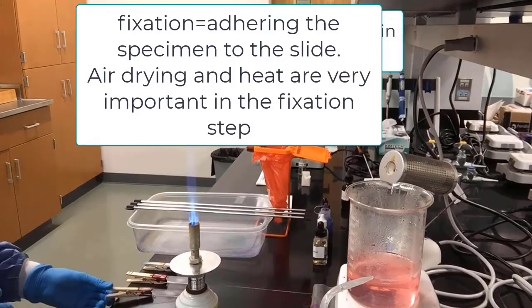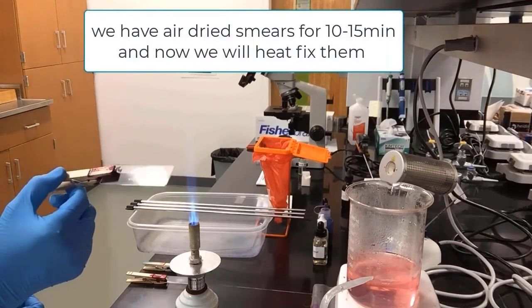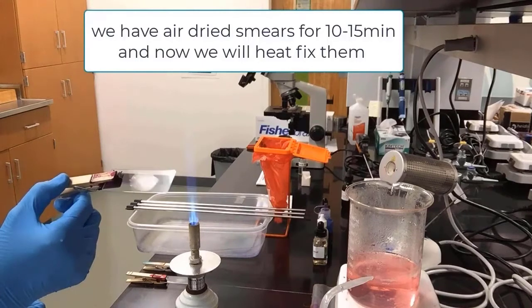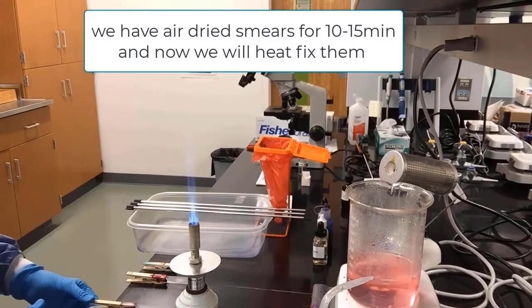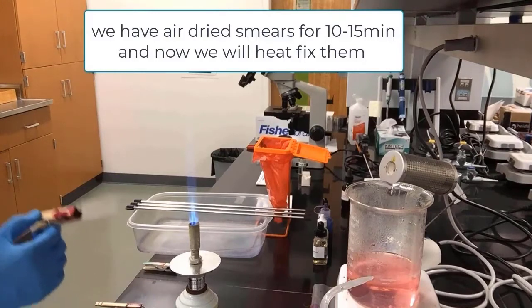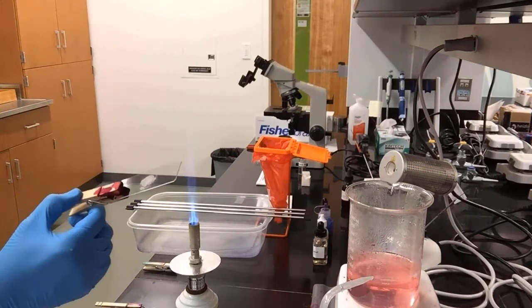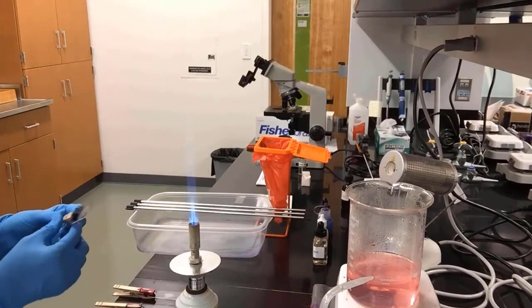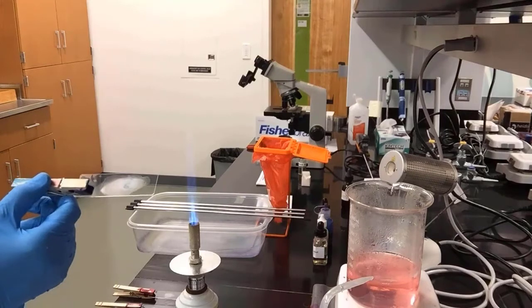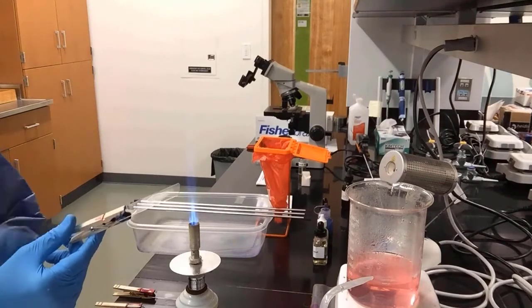10-15 minutes are over. We have clipped our slides. You can see the smears here have air dried. And remember, we have to fix them, glue them to the slide. So we have air dried them for about 10-15 minutes. They are very nice smears, ready to heat fix. And here's our 3rd smear. You can see they're nice dry smears. And now we will heat fix them.